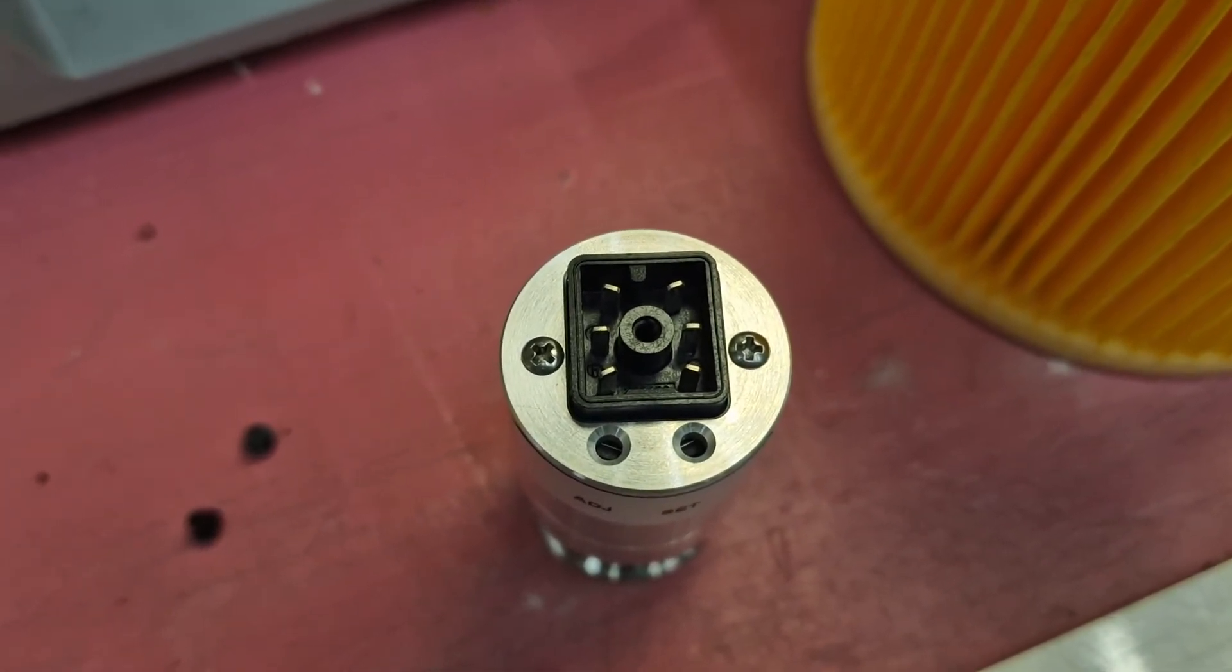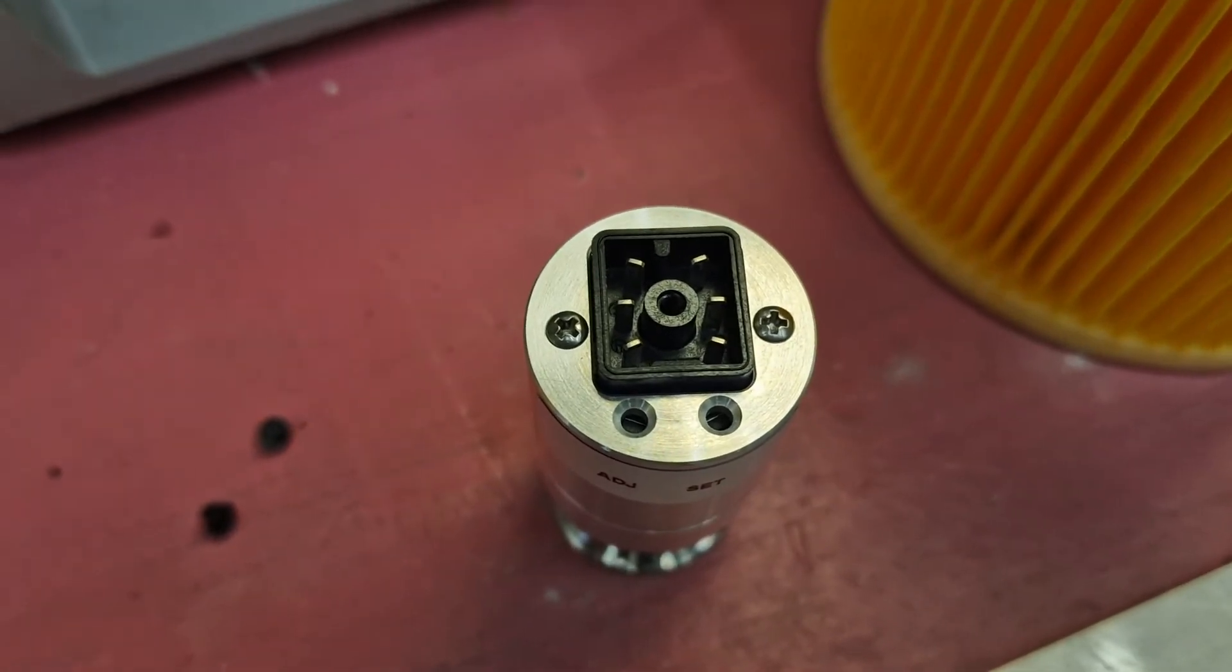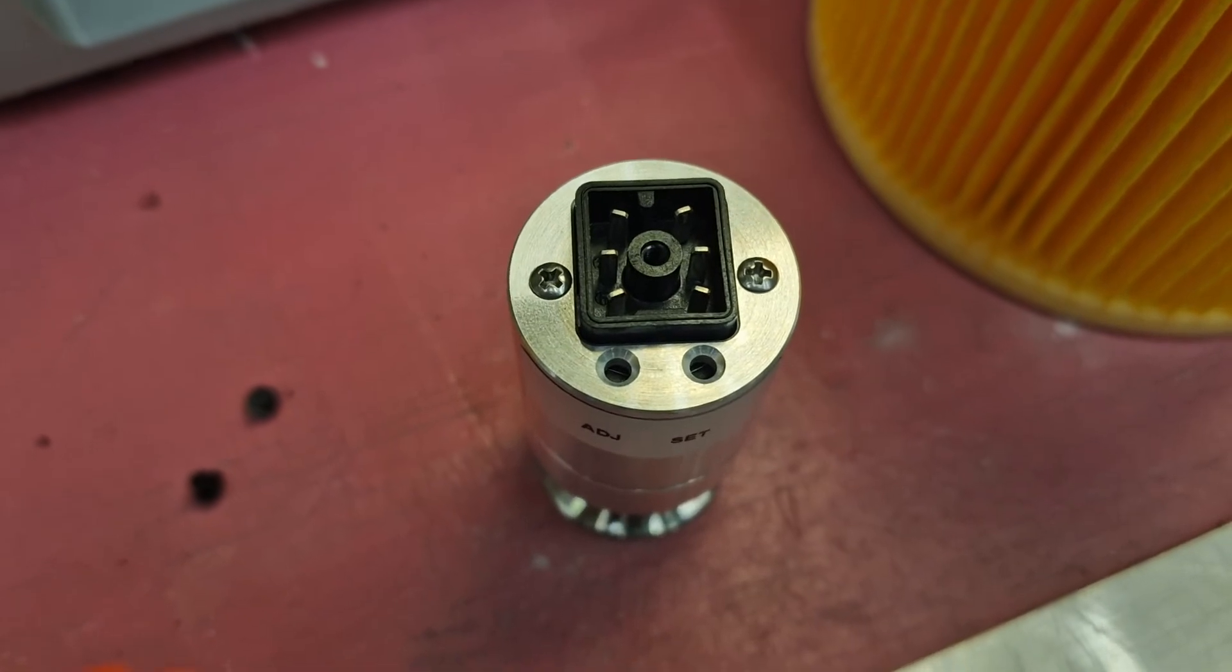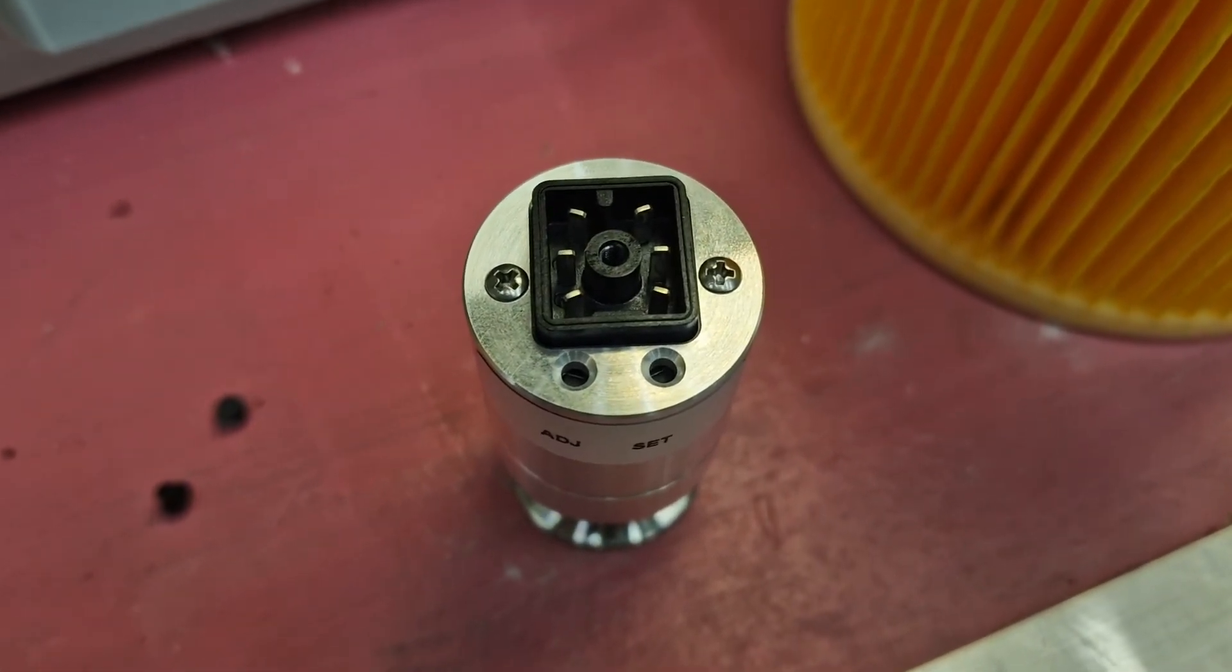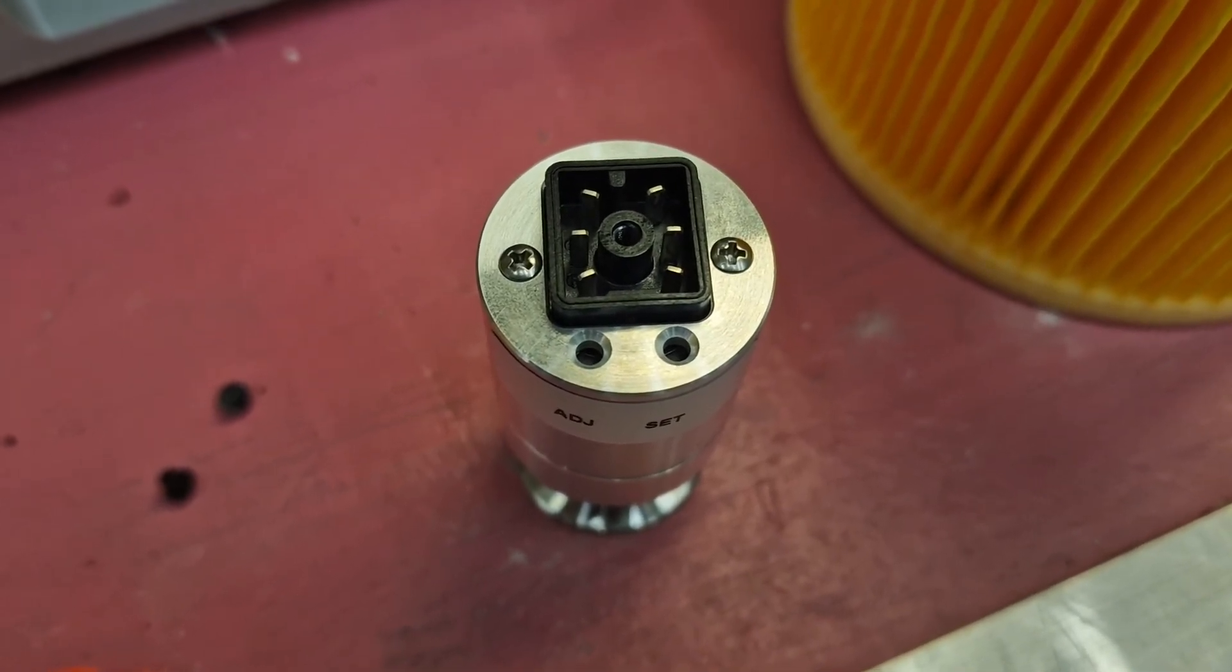Usually sensors fail due to dirt that comes into the sensor such as dry powder. We advise you to use a filter in between the sensor and the chamber.